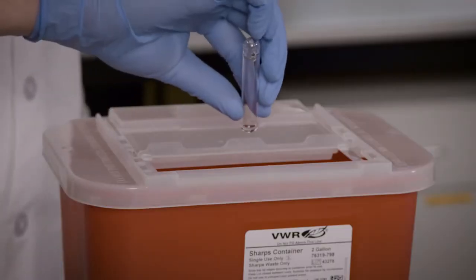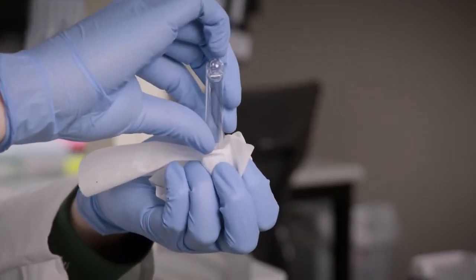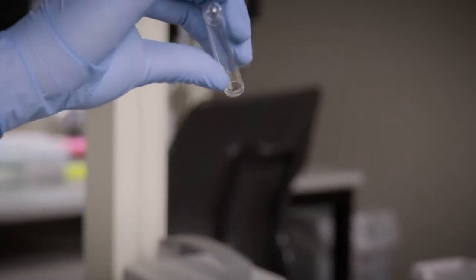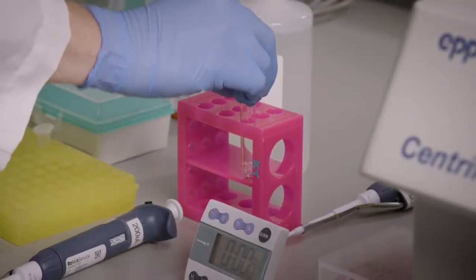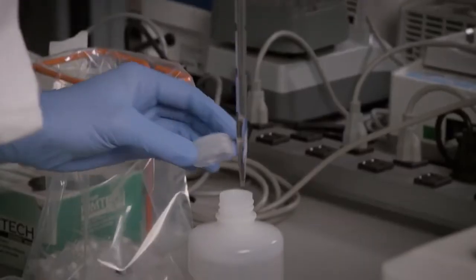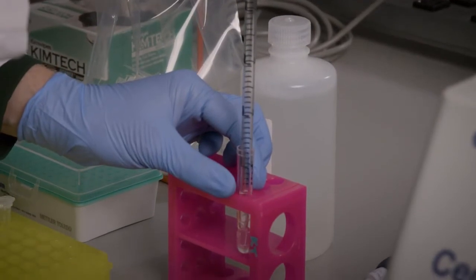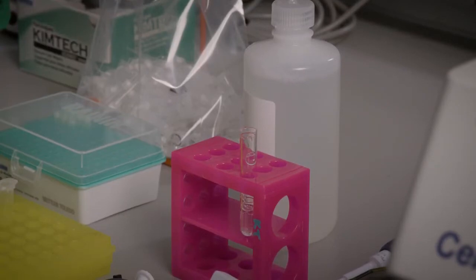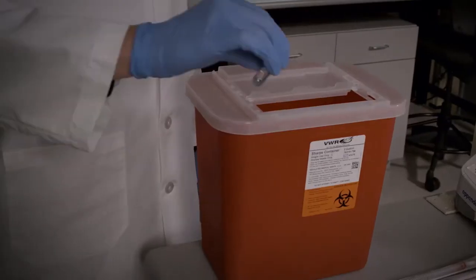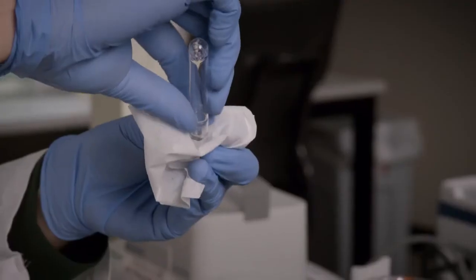Decant the supernatant, keeping the tube inverted. Gently blot the inverted tube on a lint-free wipe to remove residual liquid from the rim of the tube. Do not tilt and decant the tube multiple times to get rid of fluid, as this may dislodge the cells from the tube. Repeat the washing steps 2 more times using 2 milliliters of BD stain buffer for a total of 3 washes. After the final wash, decant the supernatant as instructed earlier and resuspend the cell pellet using the appropriate volume of BD FACS pre-sort buffer, considering cell density and sorting conditions.